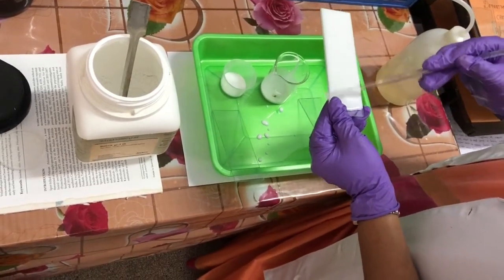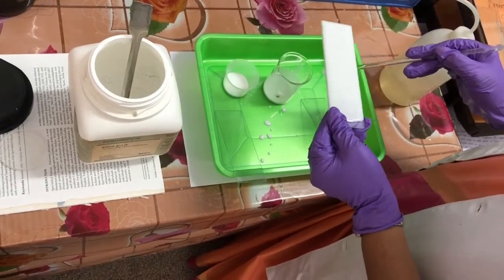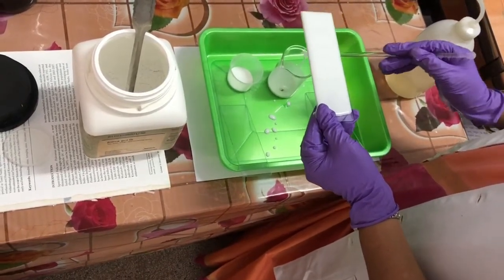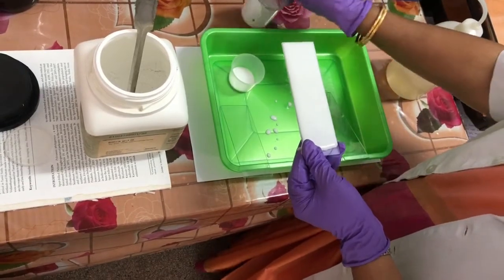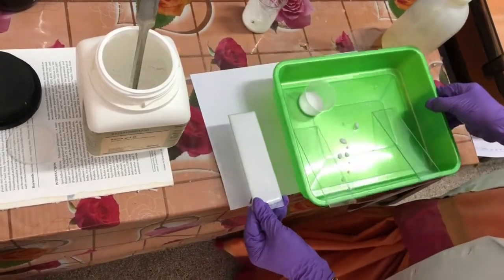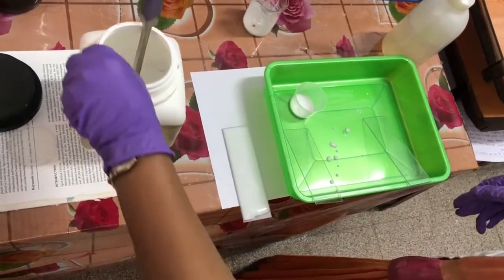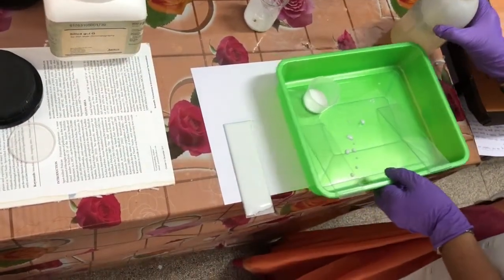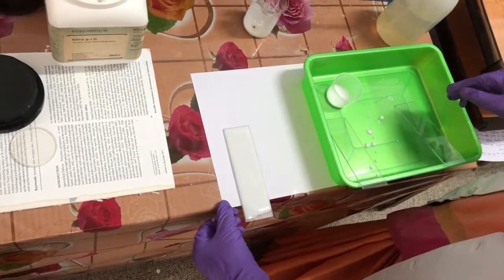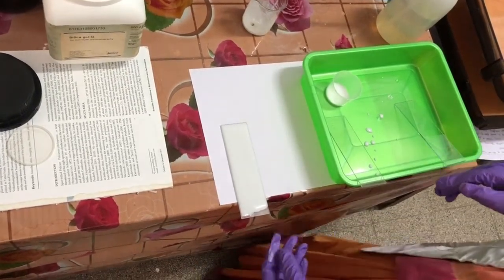Complete the edges, leave some space at the top to hold it, and tilt it slightly on both sides. Keep the plate on a clean surface to dry in air for 24 hours overnight. Then put it in an air oven, heat at 120 degrees for two hours, and your plate is ready.